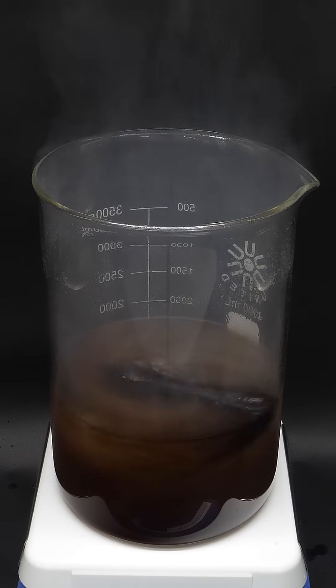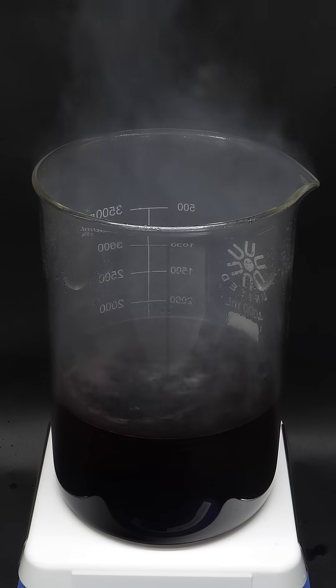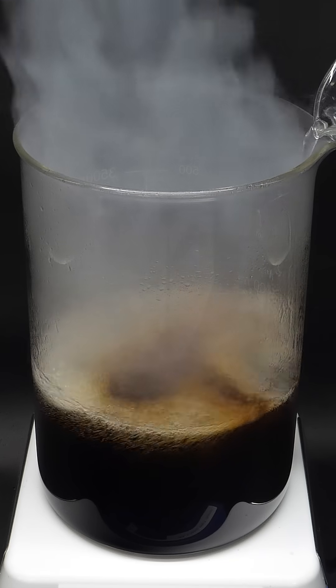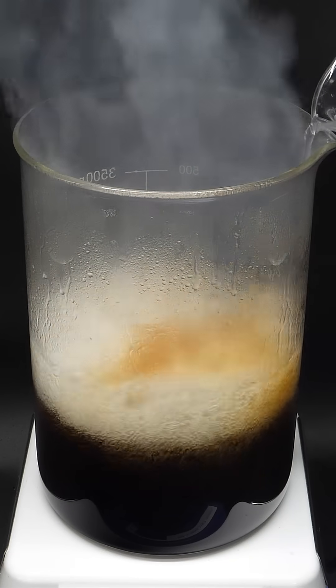It almost immediately turns black, and this is all carbon. Now, if I add some more peroxide, I can vaporize the carbon and turn it into CO2 gas.